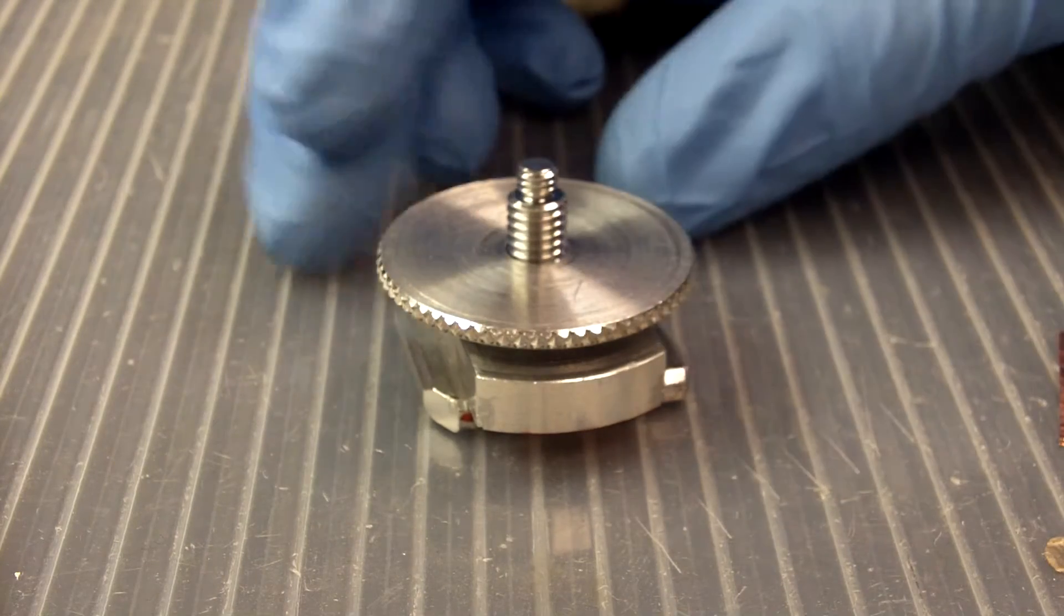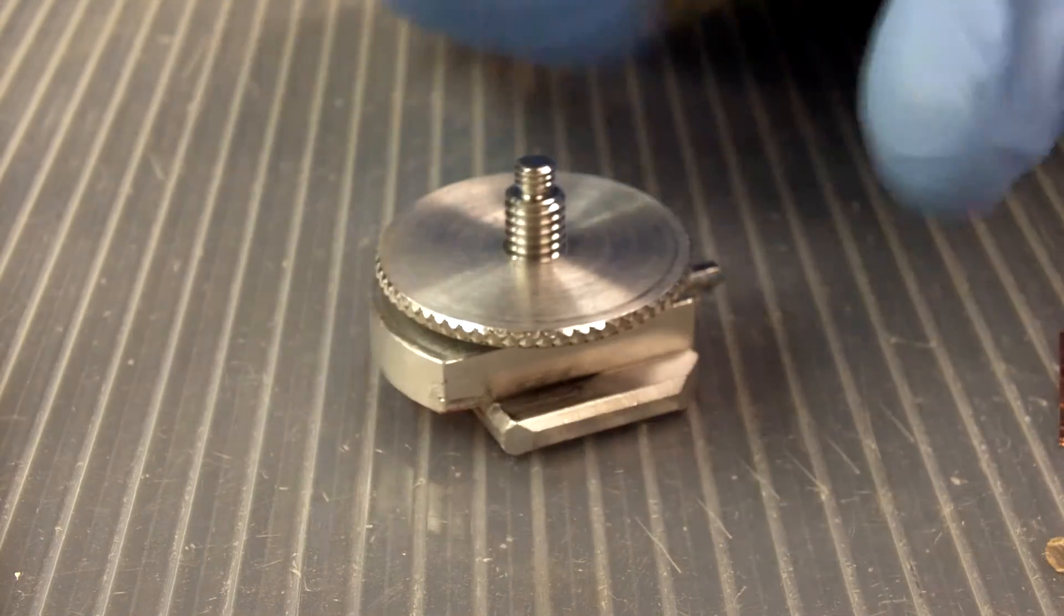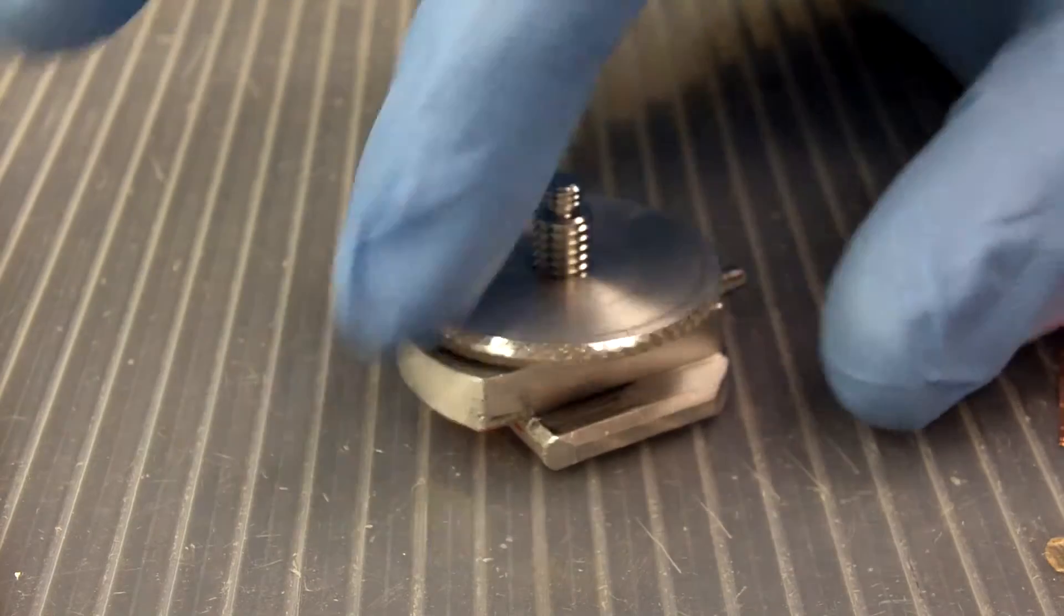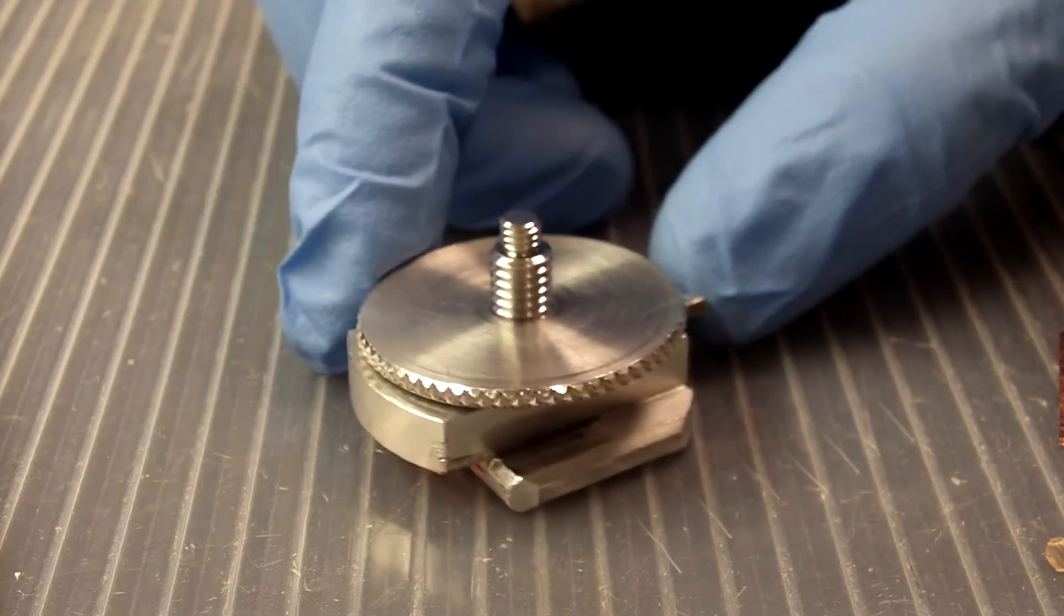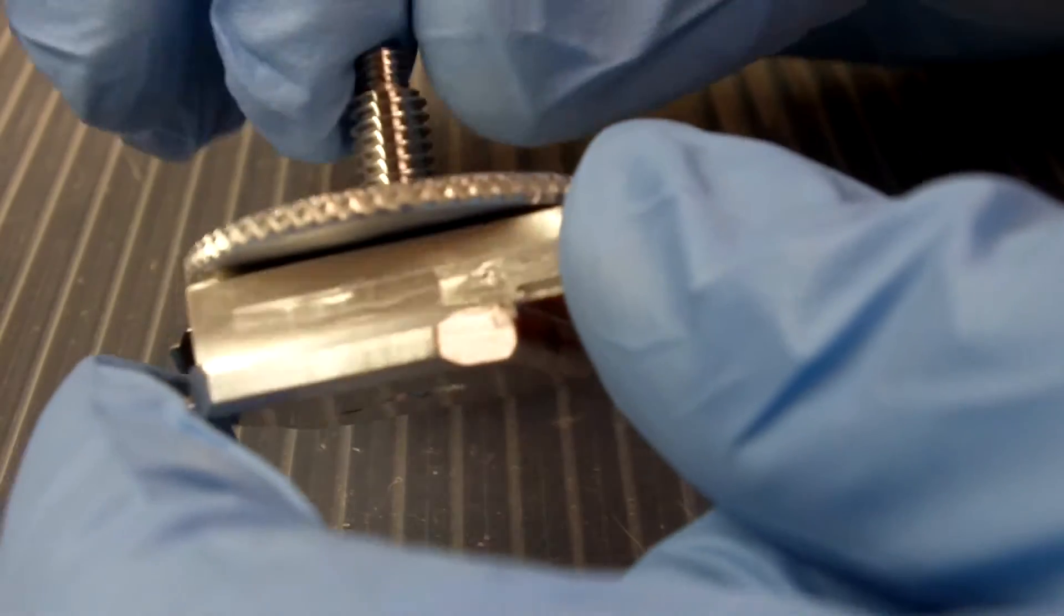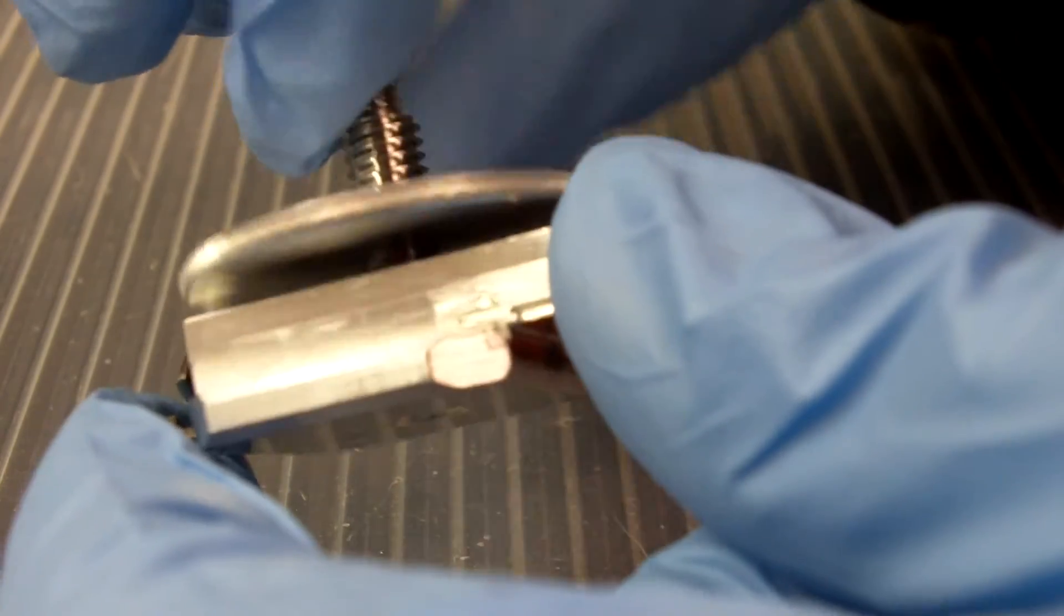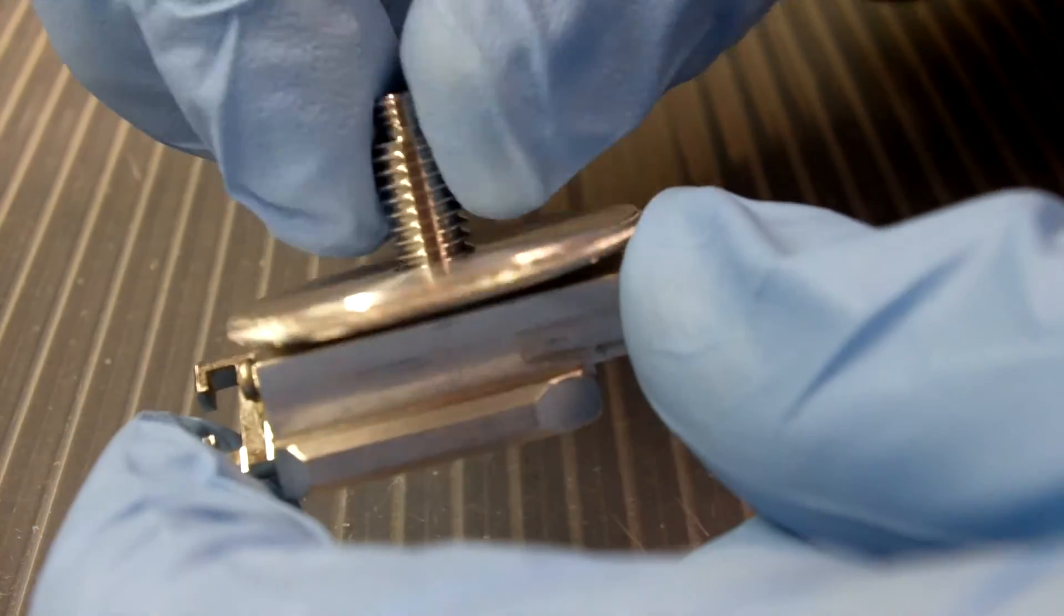The more common way of getting the screw stuck is even worse. Some users are afraid of adequately tightening the locking ring or they just don't understand what the locking ring is there to do. So a user puts the screw in and does not tighten the locking ring enough to immobilize the screw.